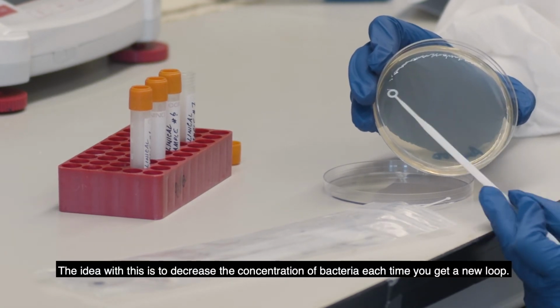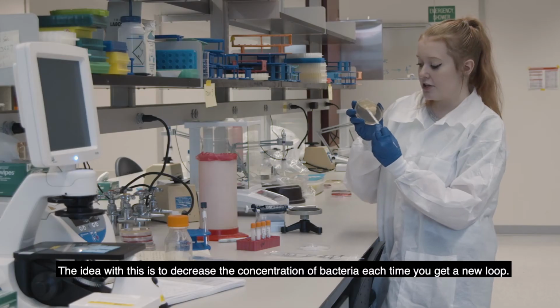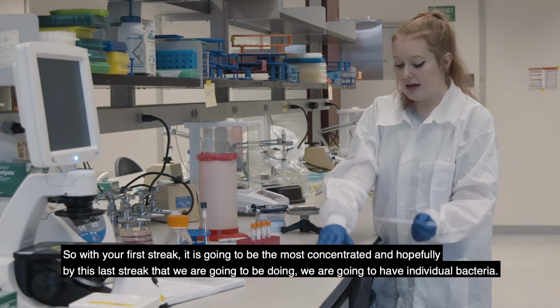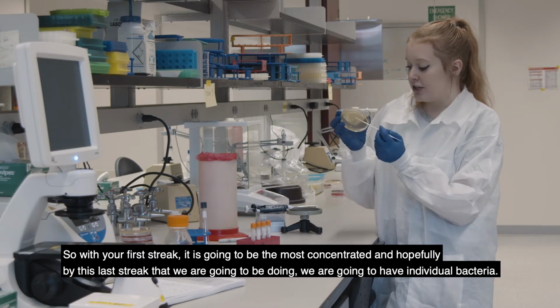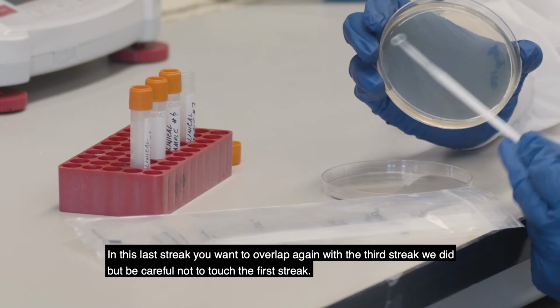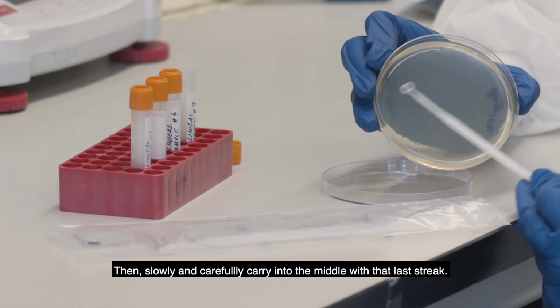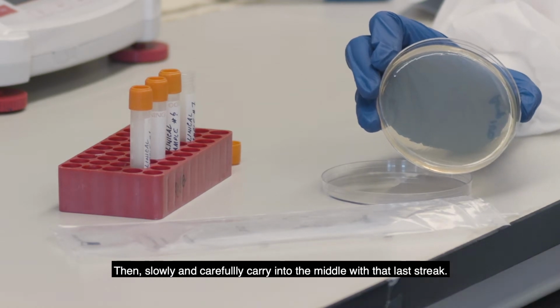And the idea with this is to decrease the concentration of bacteria each time you get a new loop. So your first streak is going to be the most concentrated, and then hopefully by this last streak we're going to have individual bacteria. In this last streak, we want to overlap again with the third streak we did, but be careful not to touch the first streak, and then slowly and carefully carry into the middle with that last streak.